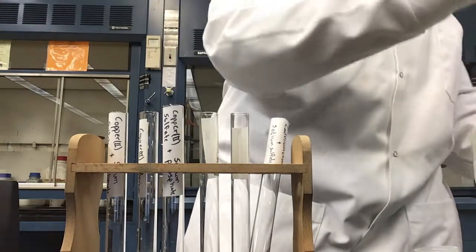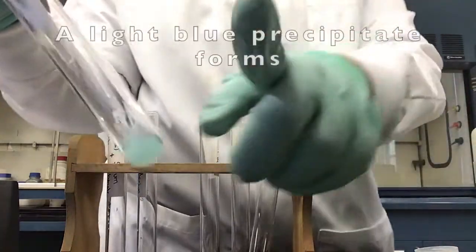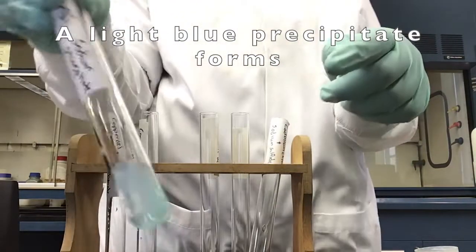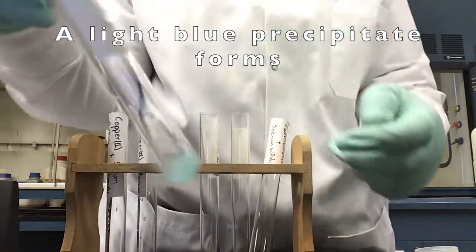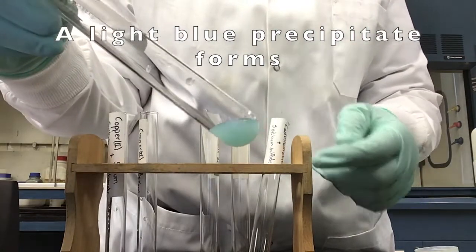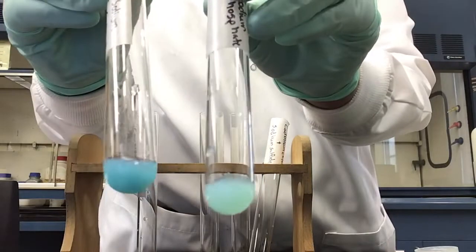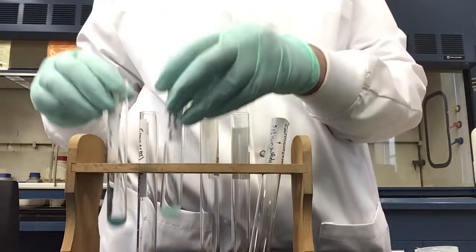Having added our copper 2 sulfate and our sodium phosphate together, we lightly tap the tube again to mix its contents. We see a light blue precipitate form inside the test tube. This light blue color is a visible difference to our first reaction that gave us a turquoise precipitate.